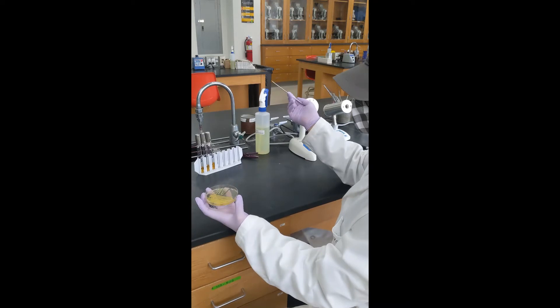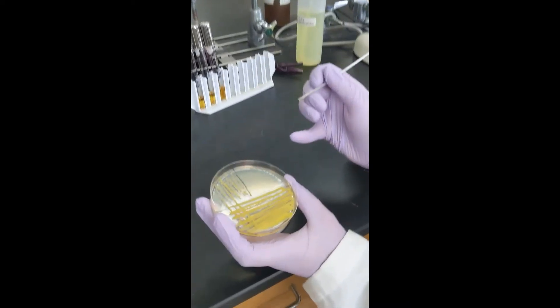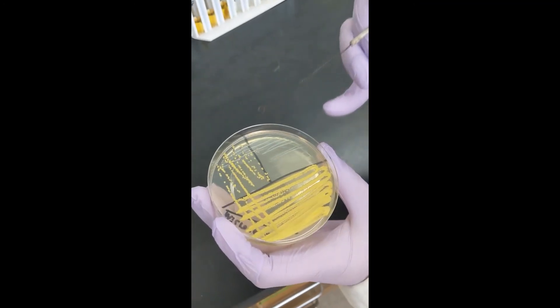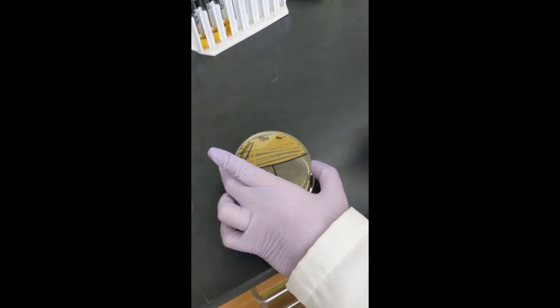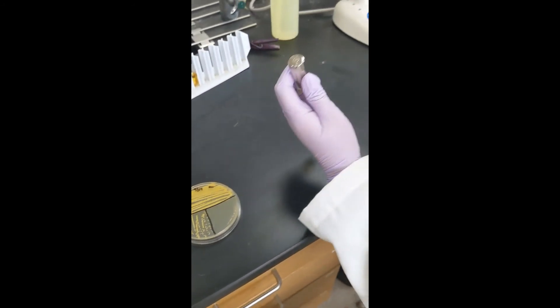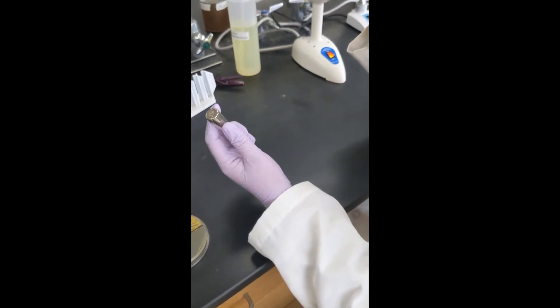Then pick a nice isolated colony from our plate. You really don't need much—even just one organism will do it for you.